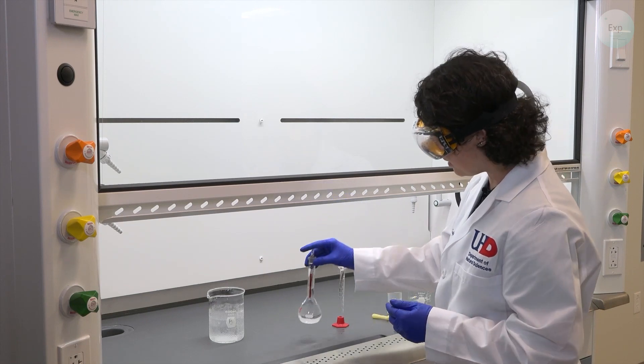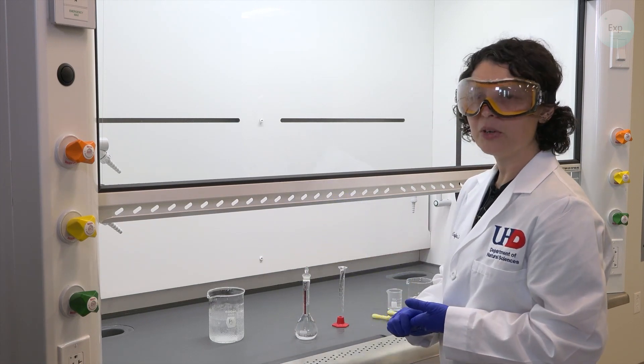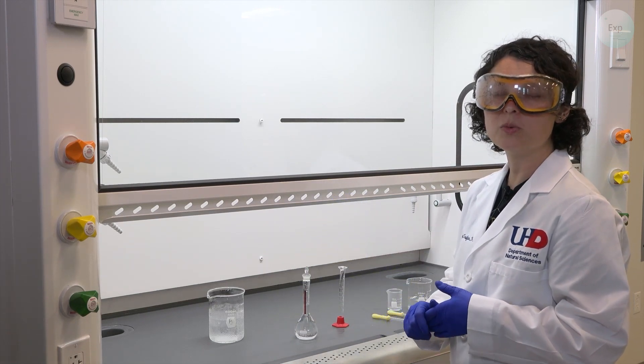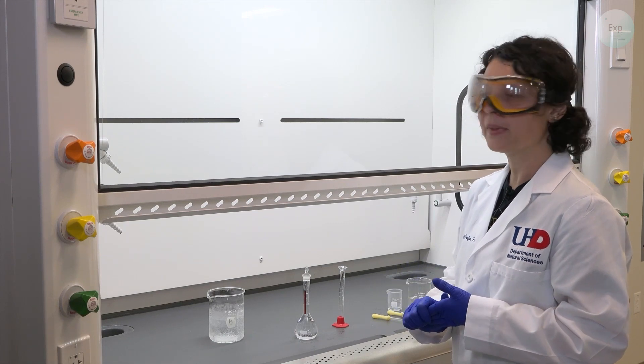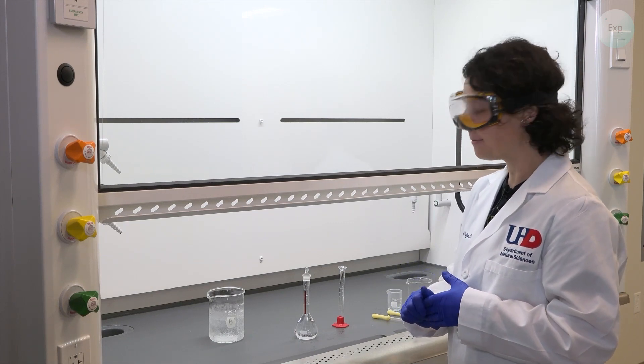And when we are done with this, we can put it down and consider our solution to be approximately one molar for the hydrochloric acid solution that we made.